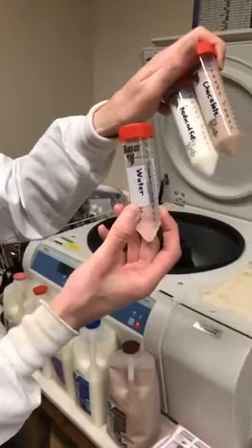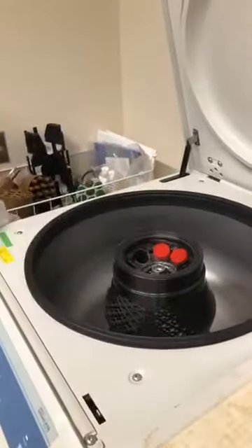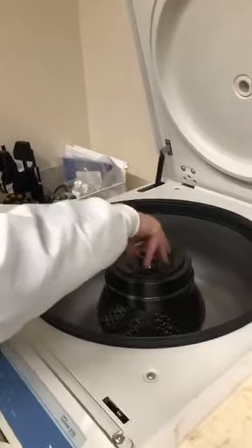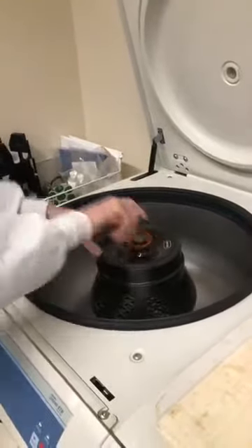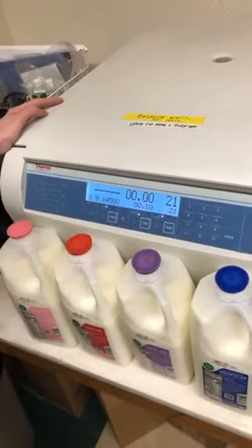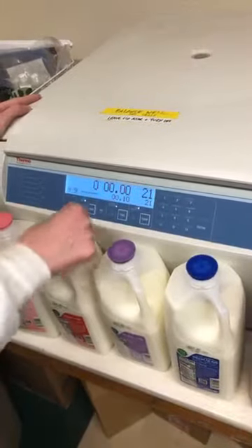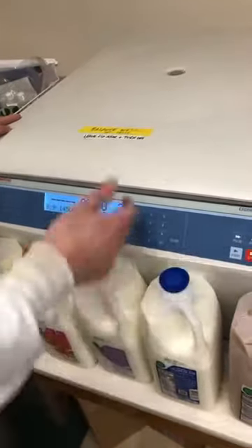And just as a comparison, water — is it possible to separate out water? Probably not, but let's do that as a comparison. I'll load up all the tubes and tighten this thing up because it's going to be spinning really fast. We do not want anything flying out. Speed — this is how much force relative to the force of gravity I'll be applying: 14,500 times the force of gravity. Let me set this for 15 minutes. If we need to stop it early, that's okay. We'll run it at room temperature.